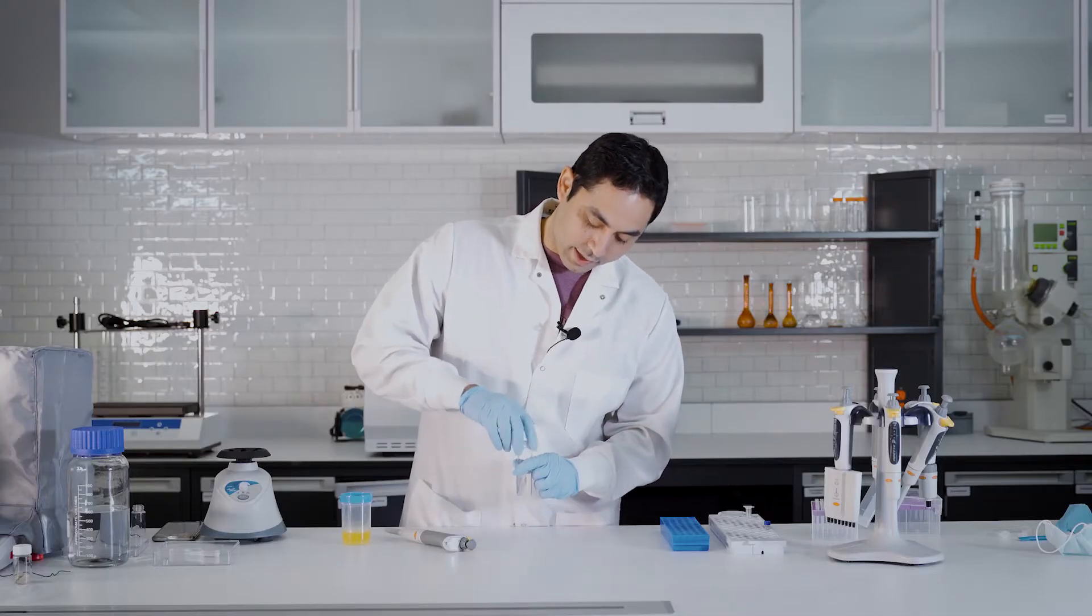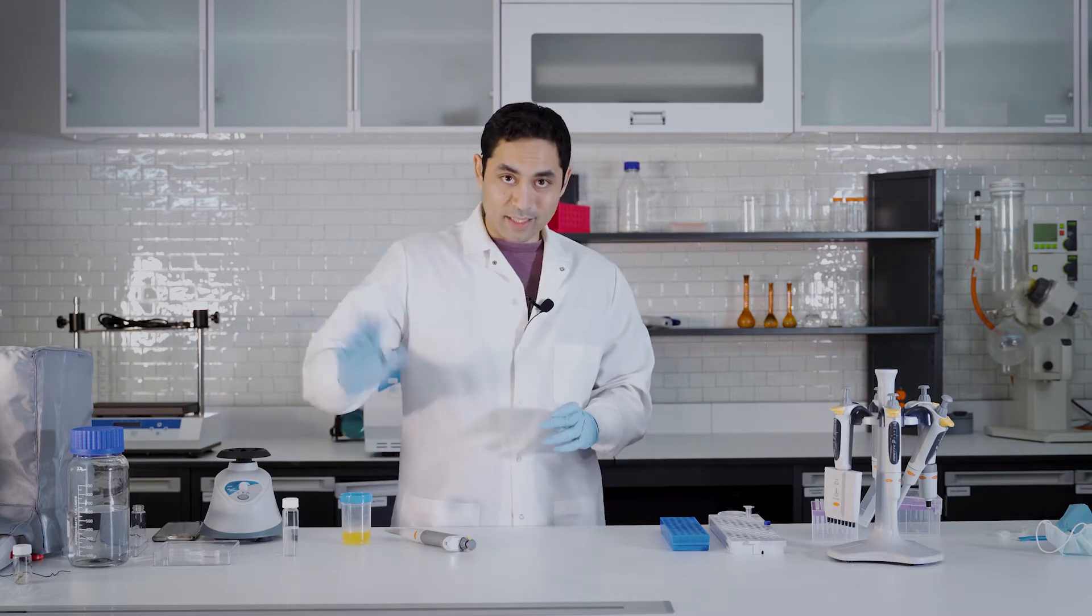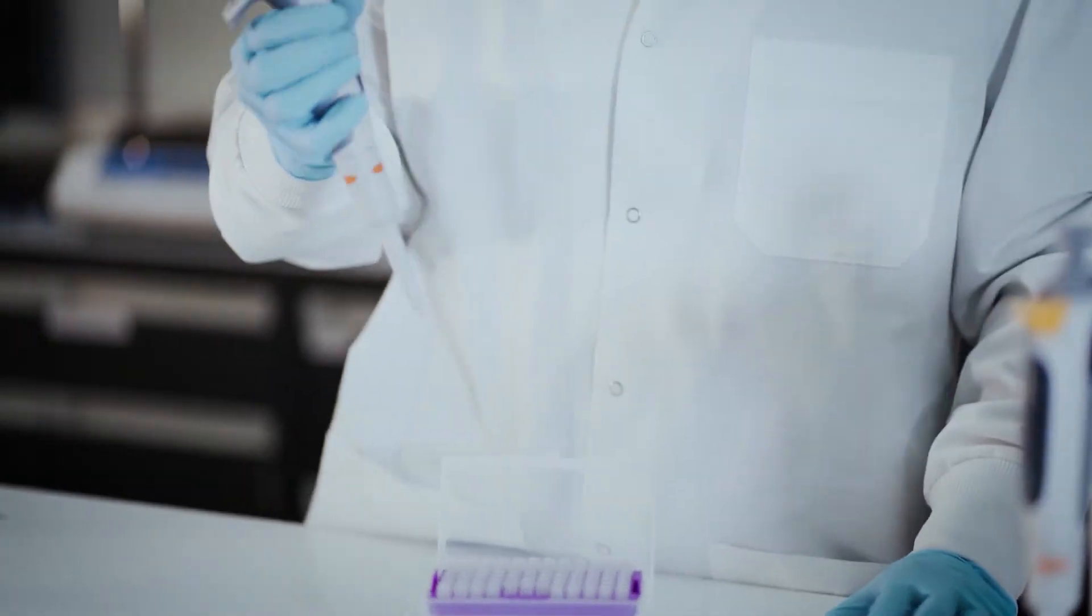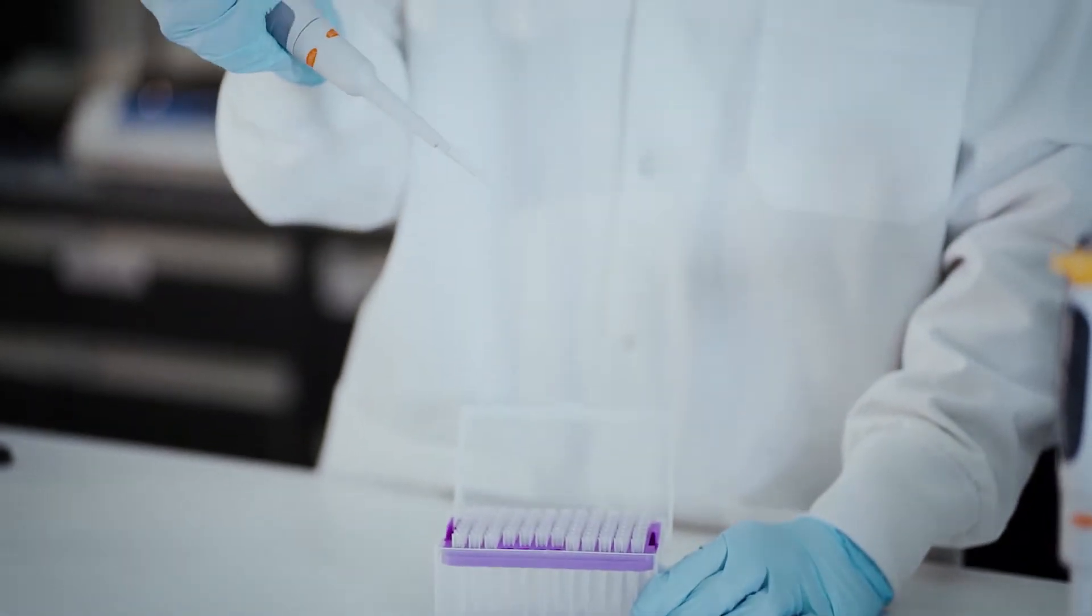So we're gonna add about 10% of that, so maybe 50 microliters of urine. I got some hot piss here. I made it this morning. Let's go and add maybe 50 microliters of that.